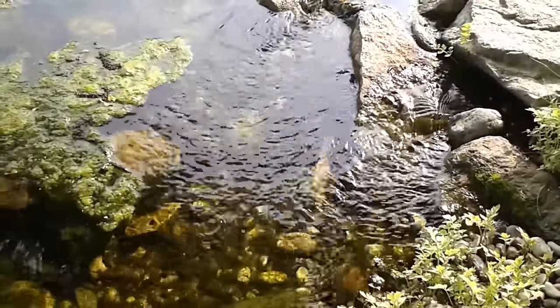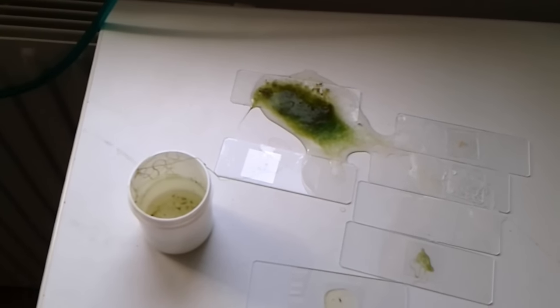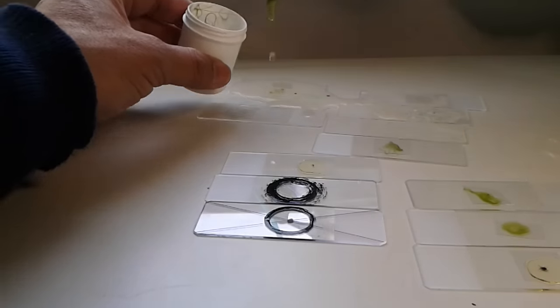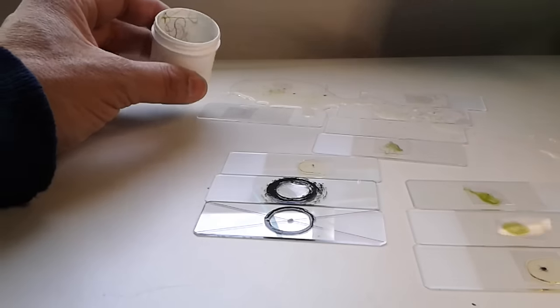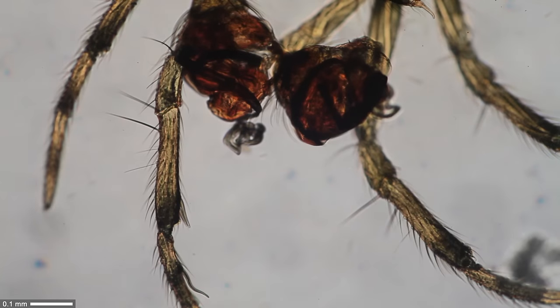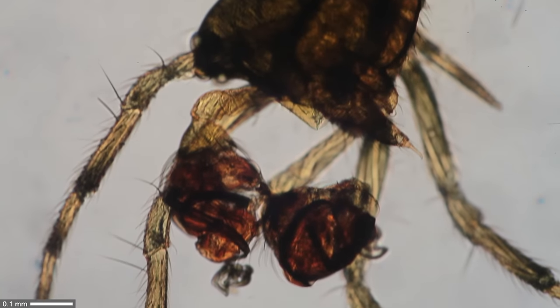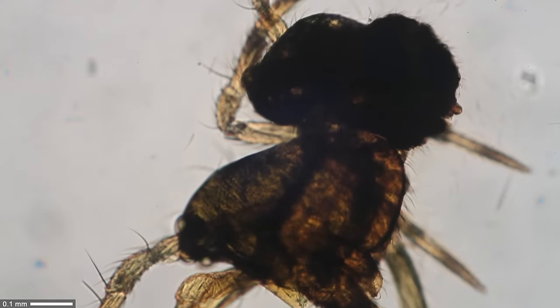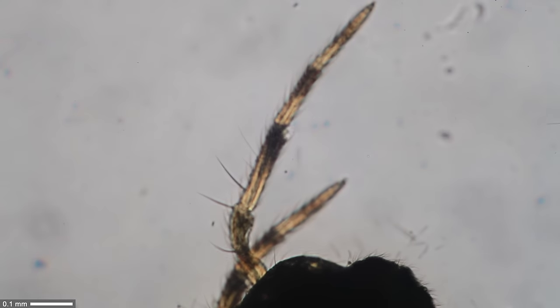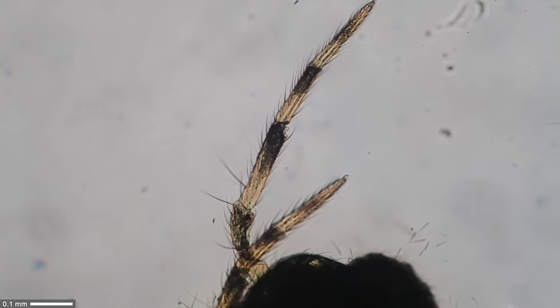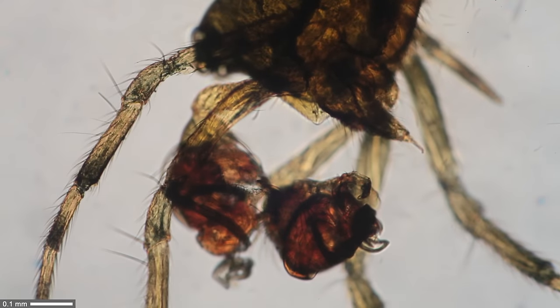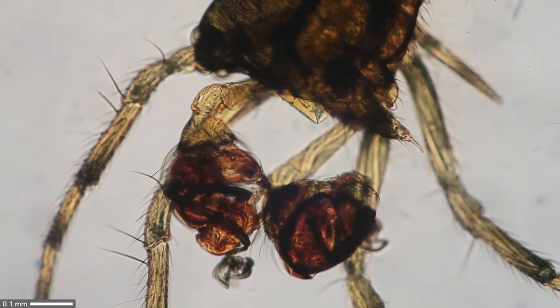What happened is the following: I spilled my water sample over my slides here. I had to clean up this mess again. I took my tweezers, put the algae back into the plastic container, and the remaining water with all of the thousands of microorganisms—I wiped it up using tissue paper. This way I killed thousands of microorganisms. But the spider, well, that is the one we feel ethically concerned about. I wonder why is this? Why is it that we feel more concerned about directly mounting a sample under the microscope slide, but we're not really concerned about killing thousands of microorganisms by cleaning up the table? Interesting paradox. But now, have a nice day.